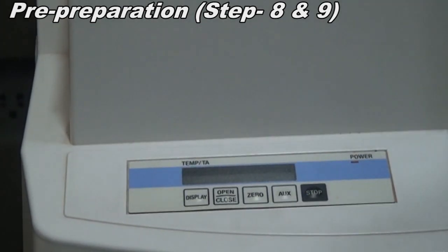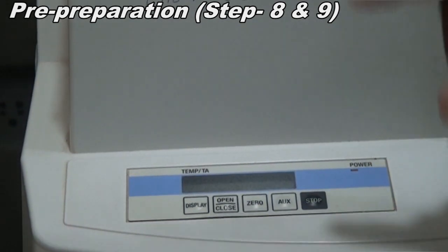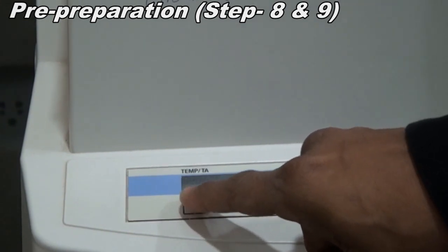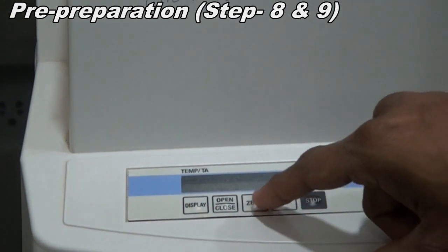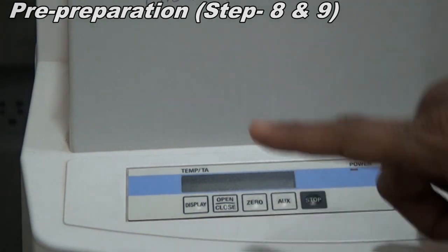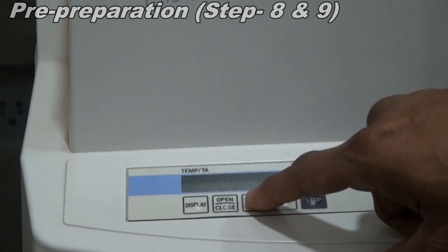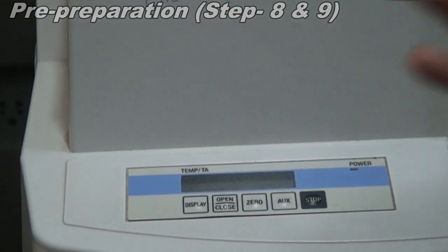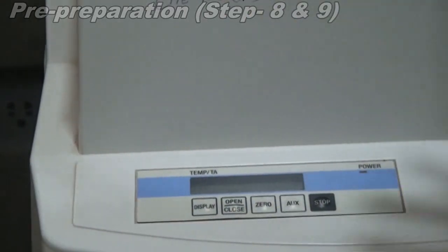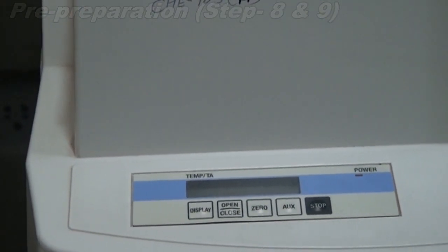It will stabilize, because as soon as it's closed, it takes time to stabilize the complete system. Then check again after 2-3 minutes, so that you can make it 0. Now I pressed 0, so it is showing constantly 0. Again similarly for the DTA signal, it's also showing 0. Now this entire system is ready for you to do DTA TGA analysis.